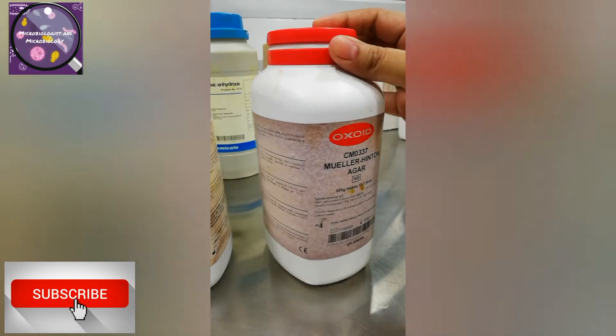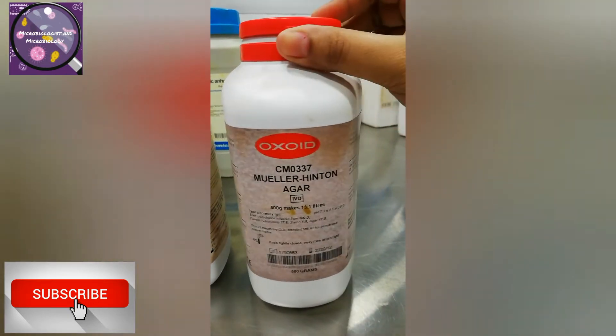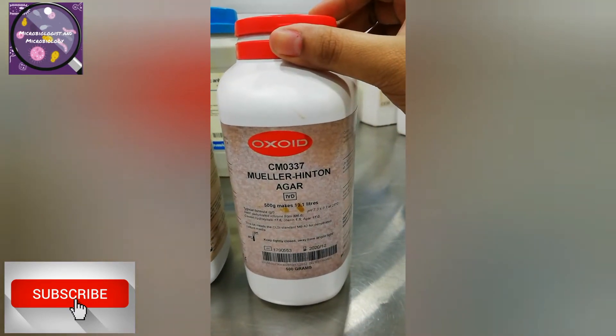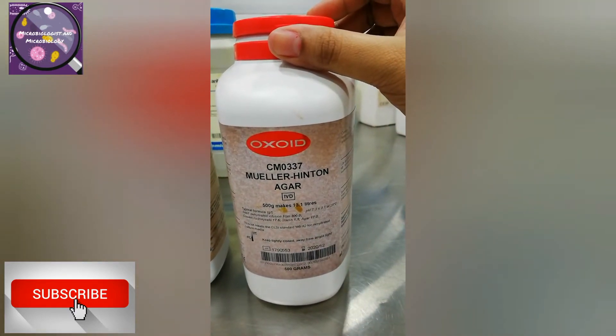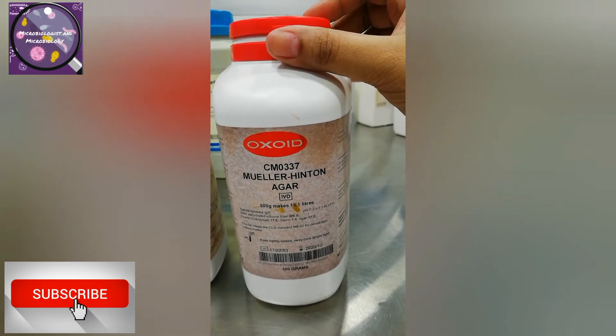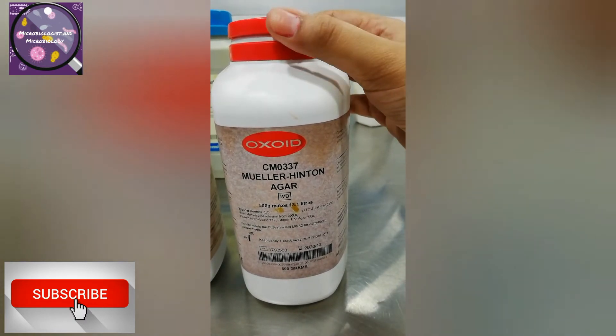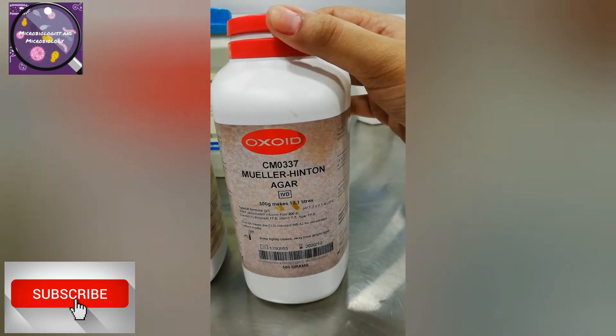Mueller Hinton agar — the brand is Oxoid. We use it for antimicrobial testing, bioassay, and antibiotic potency testing.